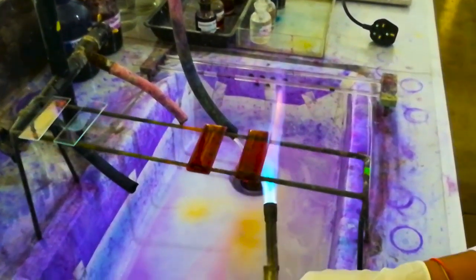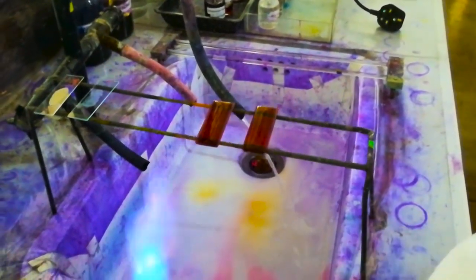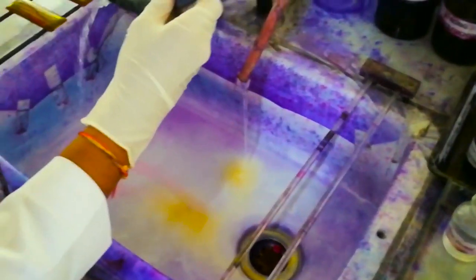Allow the heated stain to remain on the slide for 5 minutes. Then wash off the stain with clean water.